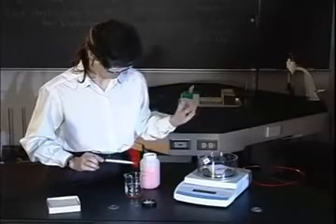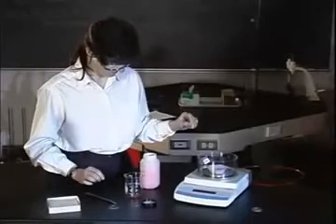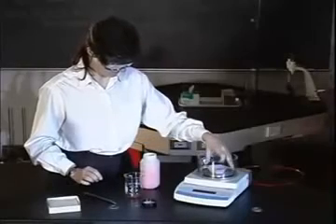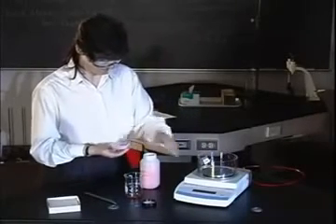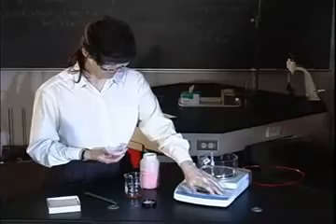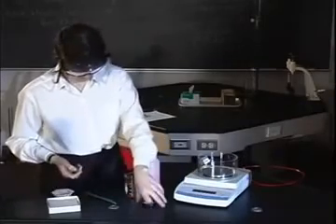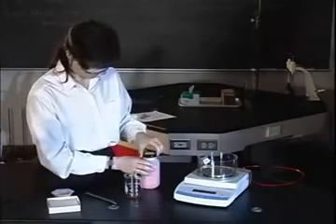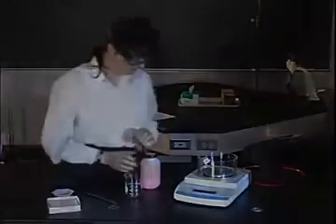Once you have transferred the desired amount of material to the weighing tray, record the mass in your notebook or on your data sheet. Never use a scrap piece of paper to record data. Remove the sample in the weighing tray from the balance. Re-zero and clean the balance.